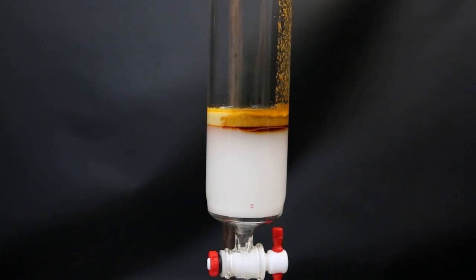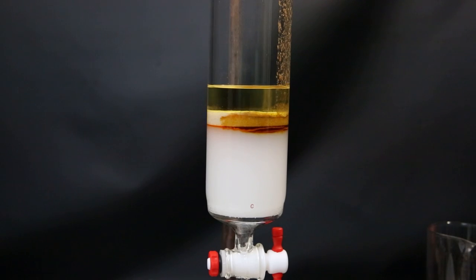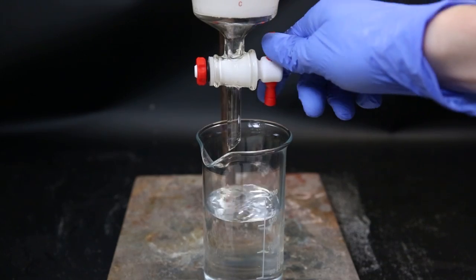I run the product into the silica and then add more eluent on top. After hours upon hours of columning and liters of collected eluent, I stopped the column.